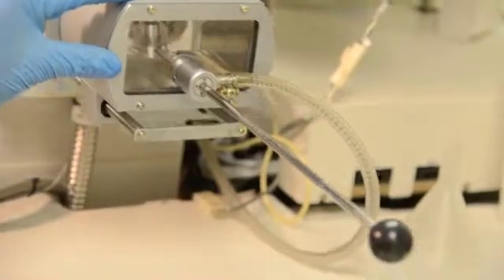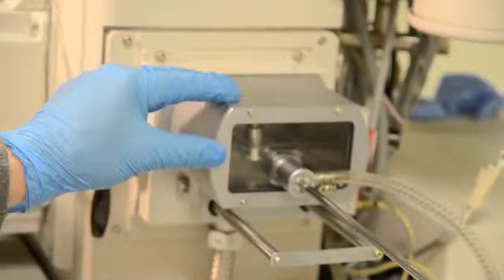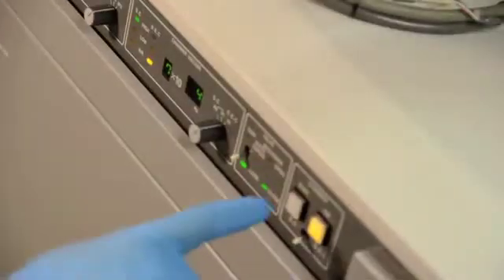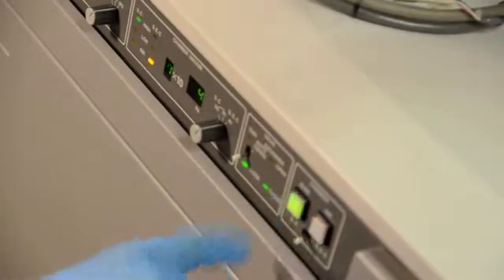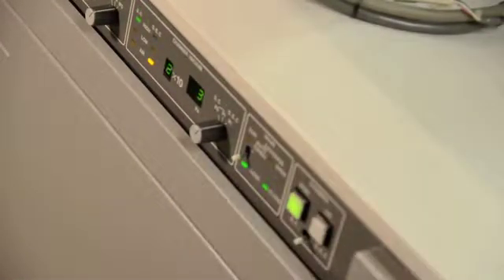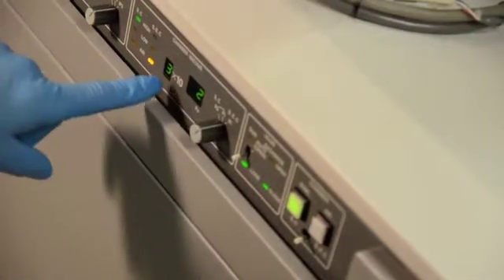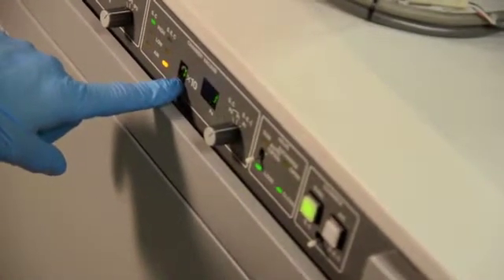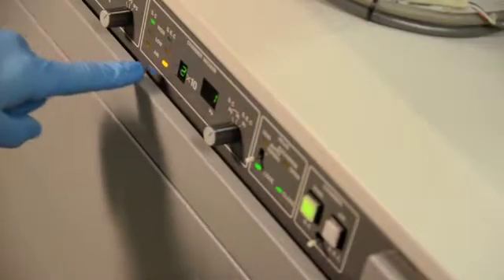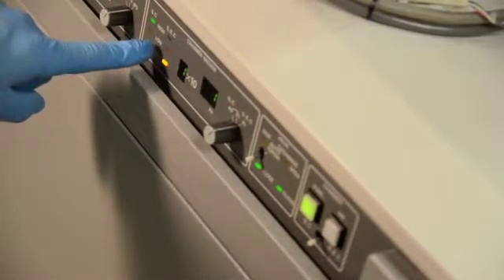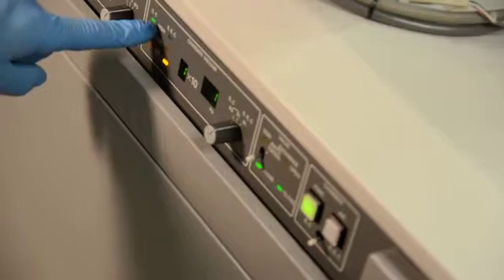Press and hold the specimen exchange chamber against the SEM column with your left hand and press EVAC. The button will turn green. You will feel the specimen exchange chamber press against the SEM column. Wait until the vacuum status for the specimen exchange chamber goes from air to low to high.